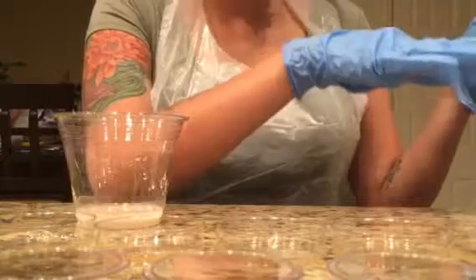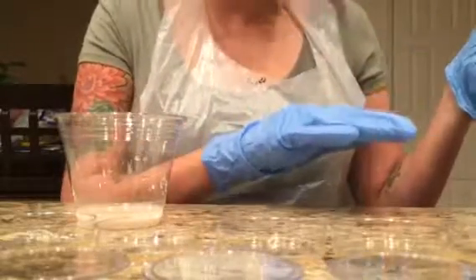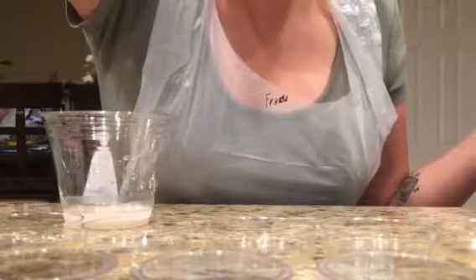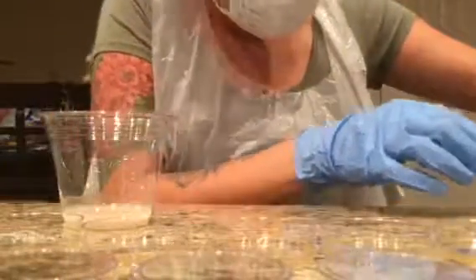I will do that for all 6 of the test tubes into their corresponding dishes, again adding only 4 drops. After doing so, I will then close the plates and then swirl the plate gently to spread the solution evenly. And then from there, just clean up.